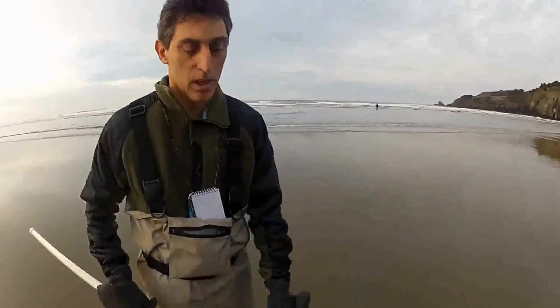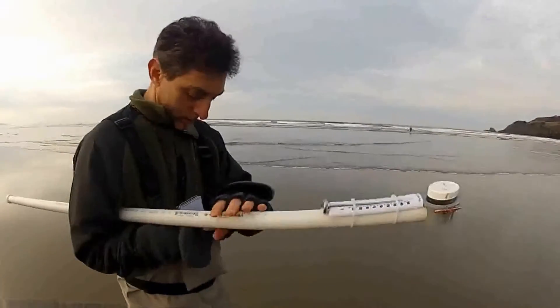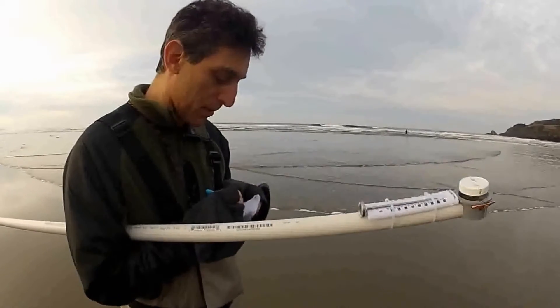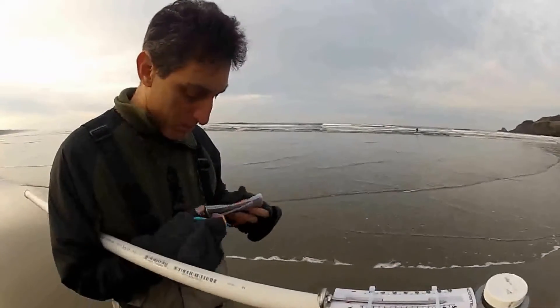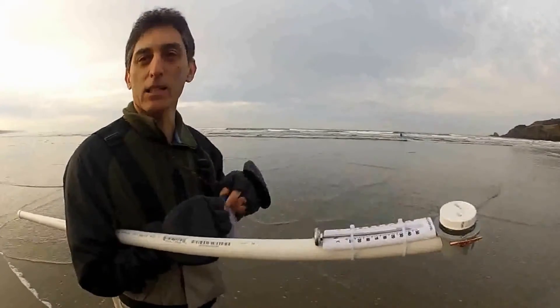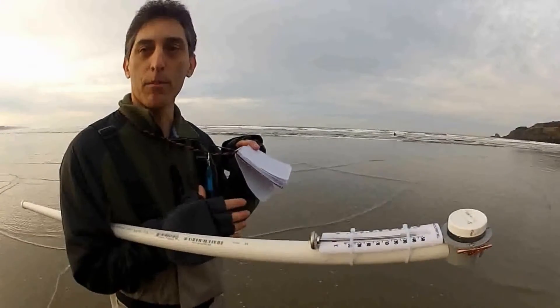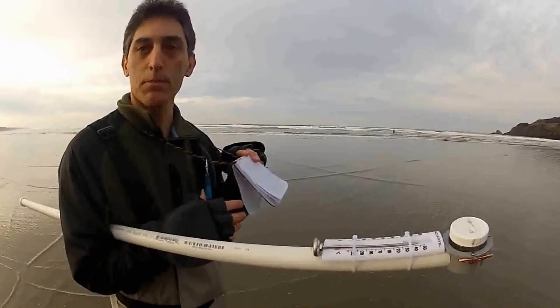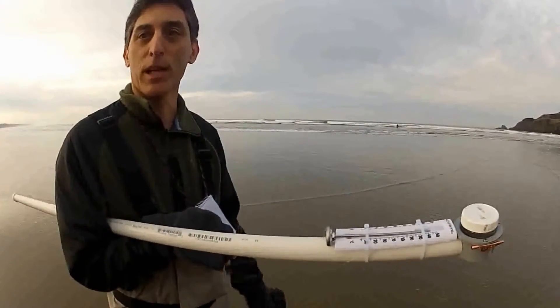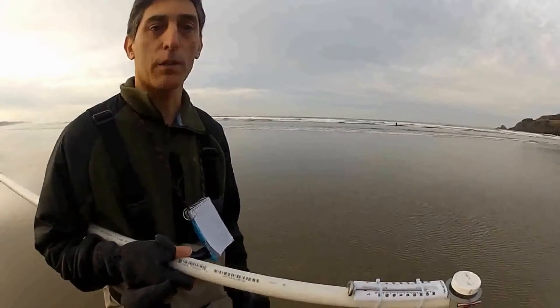I let the stick in a little bit longer than I normally do — I was just trying out the two different thermometers to see how quickly they read. They both read 50 degrees after about a minute in the water. Make certain your sample has as little sand as possible. I think we are pretty much done with the sample part. Now let's record the water temperature. I take this data back and when I drop off the sample at the lab, that's when I actually fill out my data sheet. I find using this little pad and pen combination a lot more convenient — especially when it's raining and your sheet gets wet. So I just transfer the basic data: water temperature and air temperature.